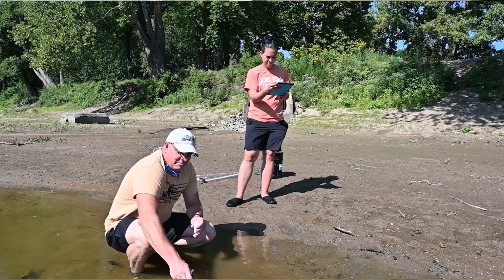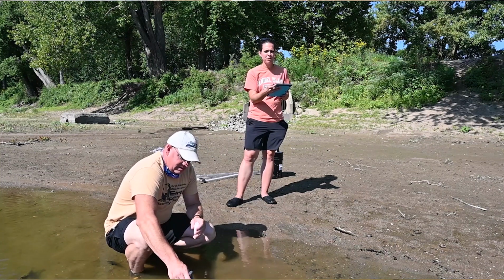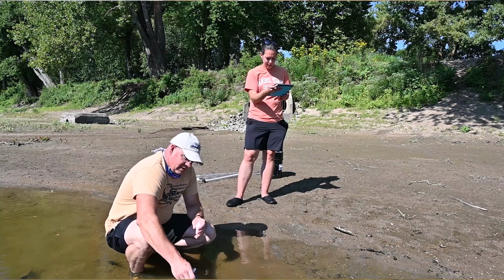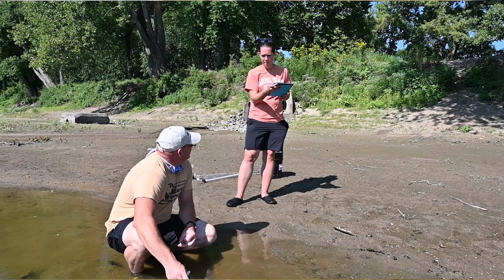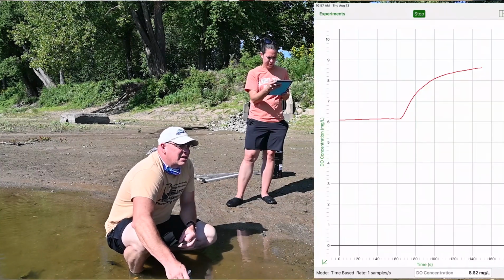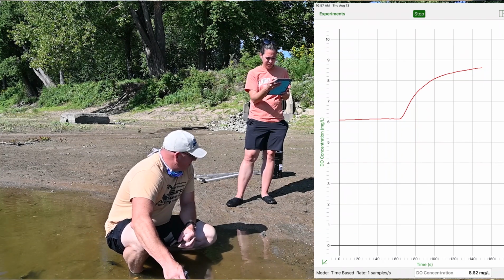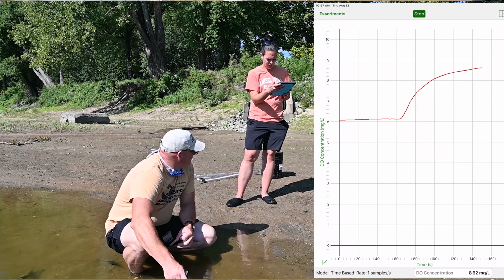So you've got to do this as a team. What are we looking at, Sarah? Before you put it in, it was right at about 6 milligrams per liter for dissolved oxygen, and it's still climbing, about 7.7. It won't measure dissolved oxygen in the air, right? Right. So we just need it to stabilize. Right now we're waiting for it to stabilize so that we can figure out what our reading is. It's going up. Starting to taper off. What are we at right now? Right now we're at 8.35 milligrams per liter. Still increasing.